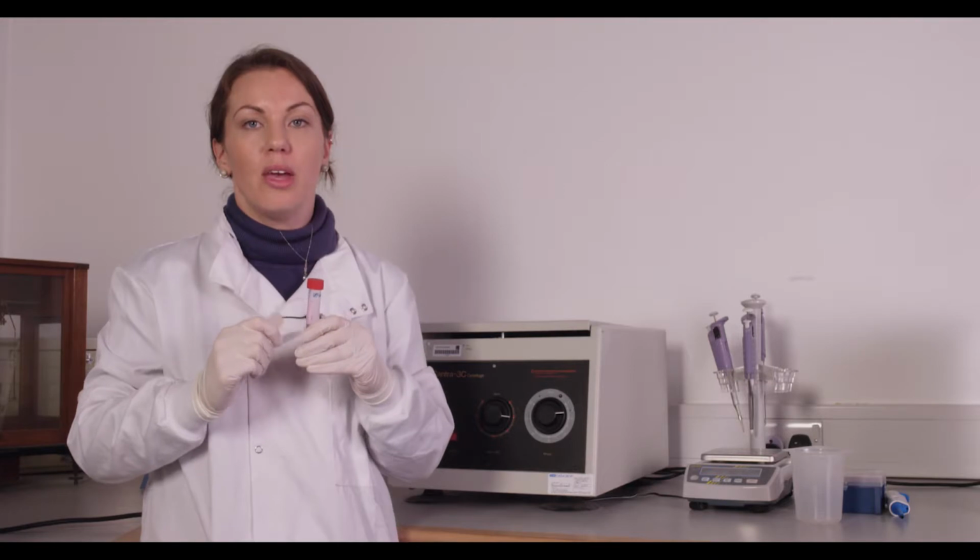Once you've got your cells in suspension, you'll need to centrifuge these down to produce a pellet. In order to do this, again, you'll always use whatever protocol you normally use to passage your cells. In our case, with Jurkat cells, K562 cells, and our HeLa cells, we use 1,000 RPM for 5 minutes, and that's sufficient enough to get us a pellet at the bottom of the tube in order to resuspend in our DEP medium. This will make up your first wash.